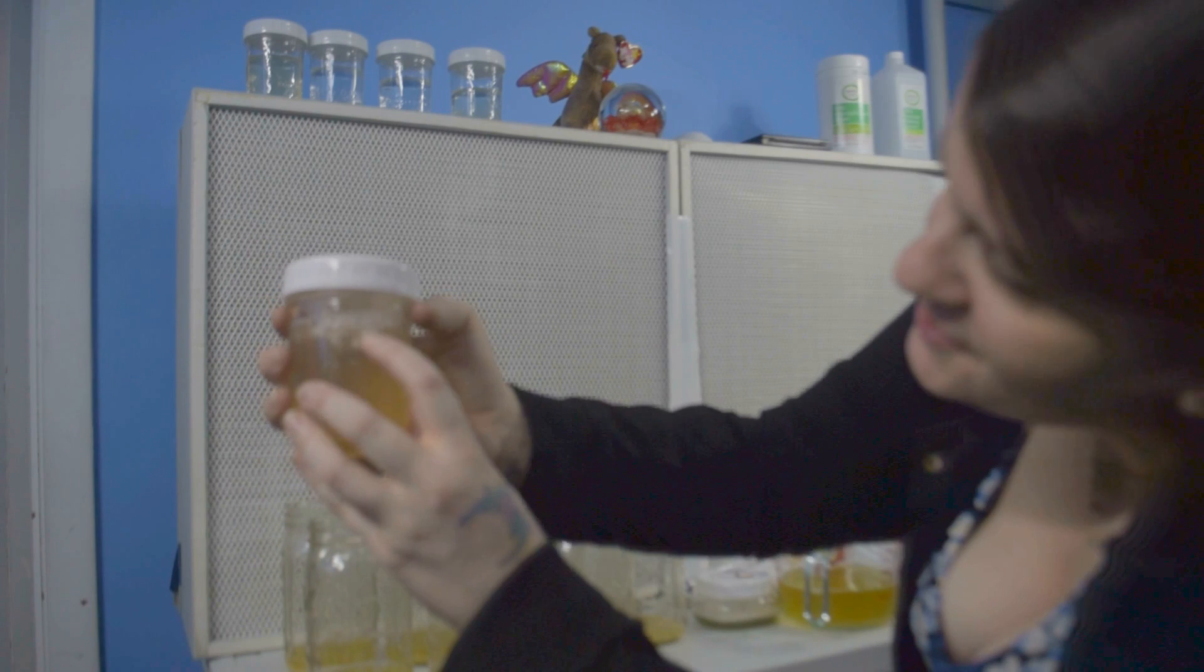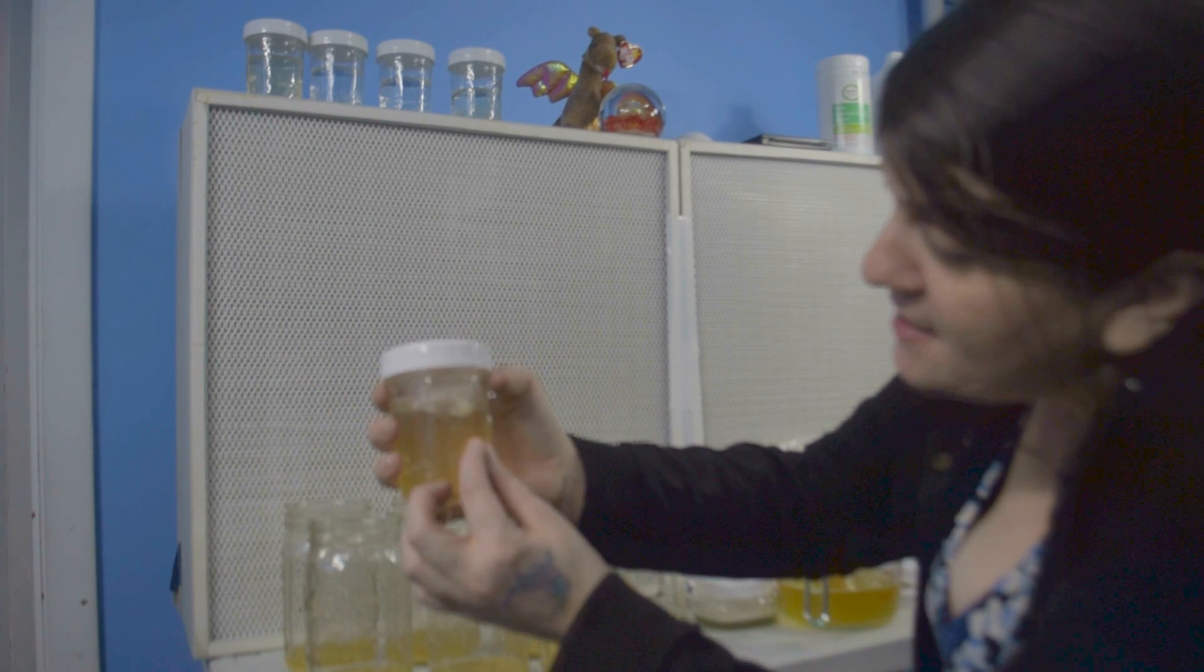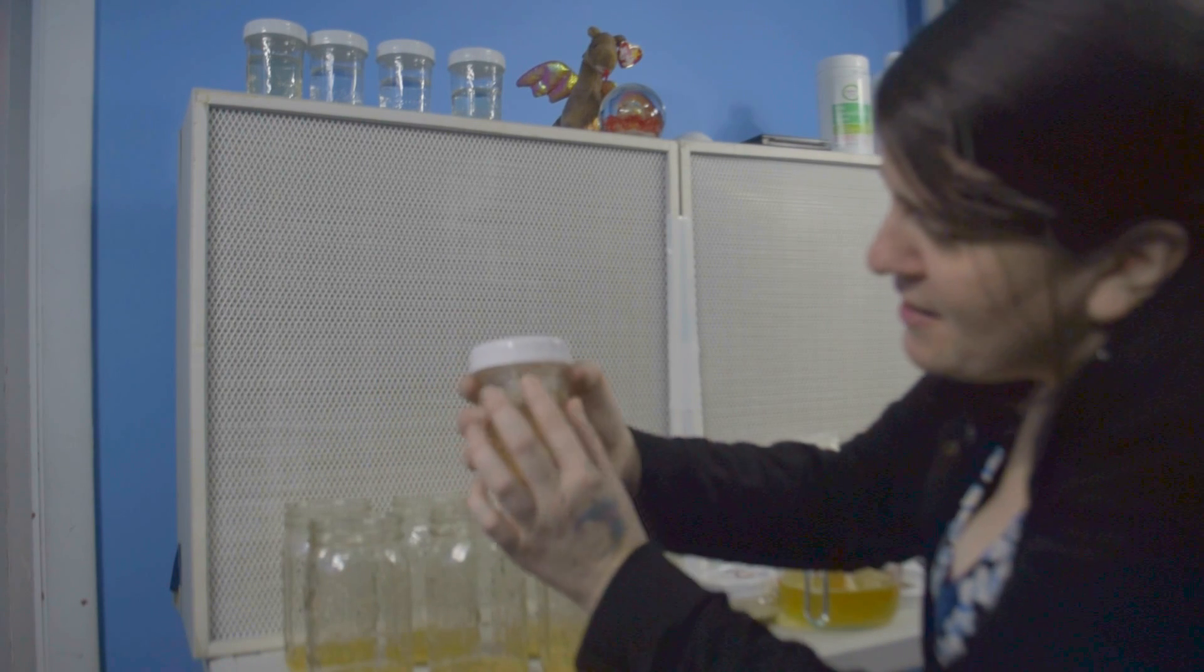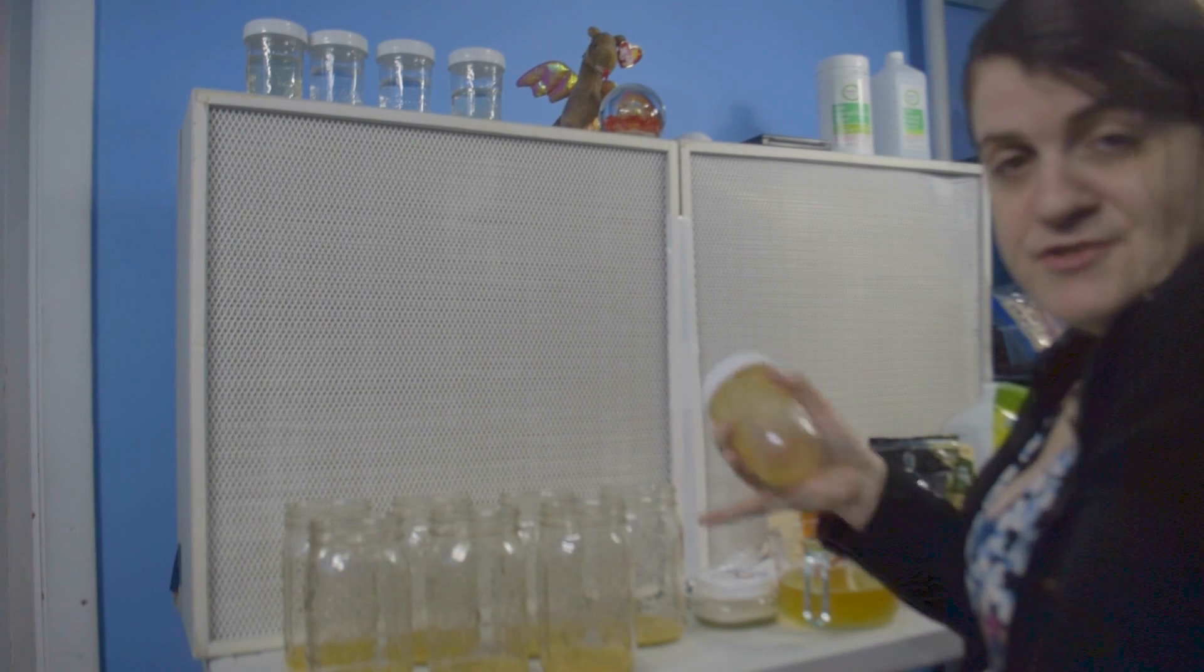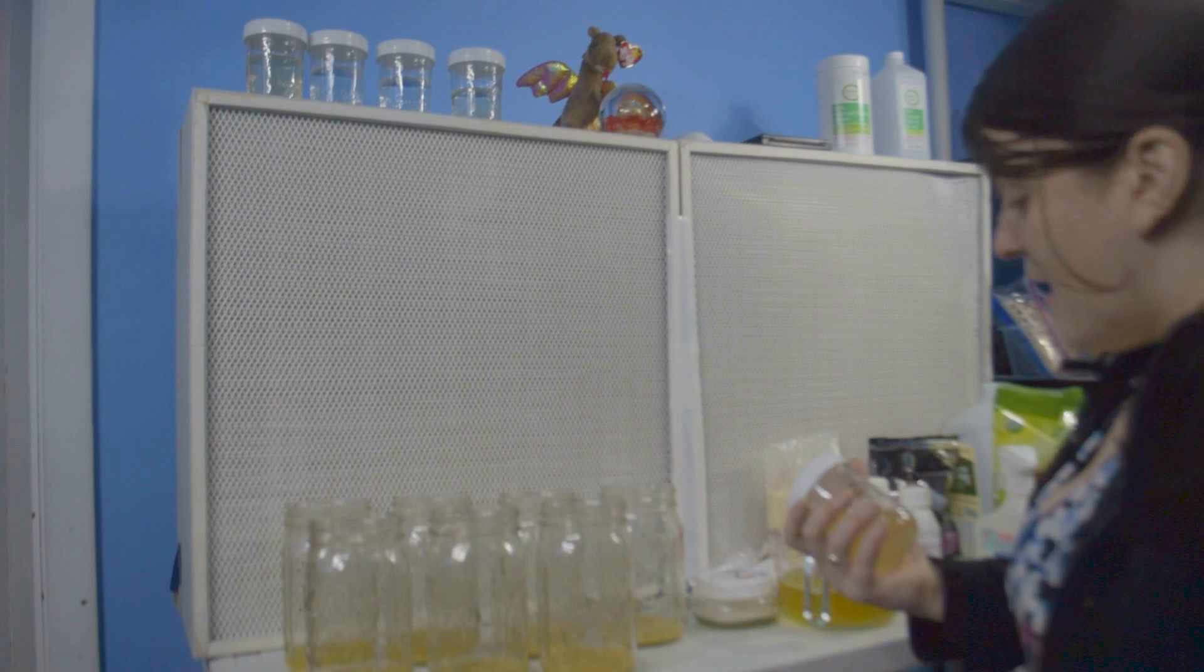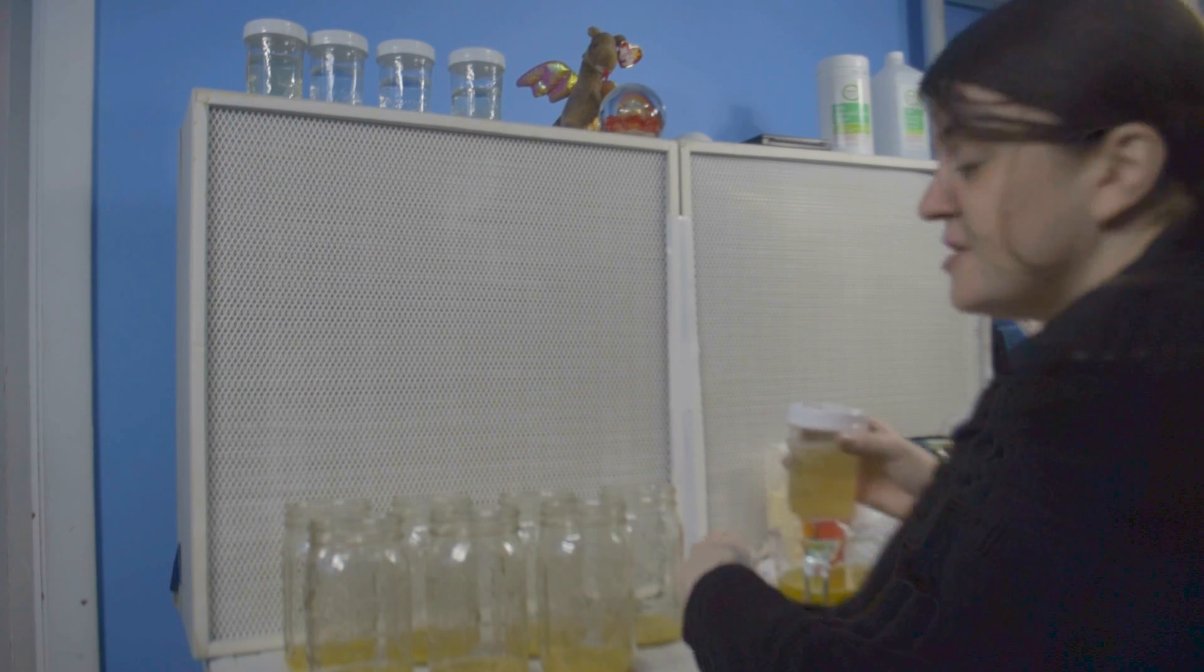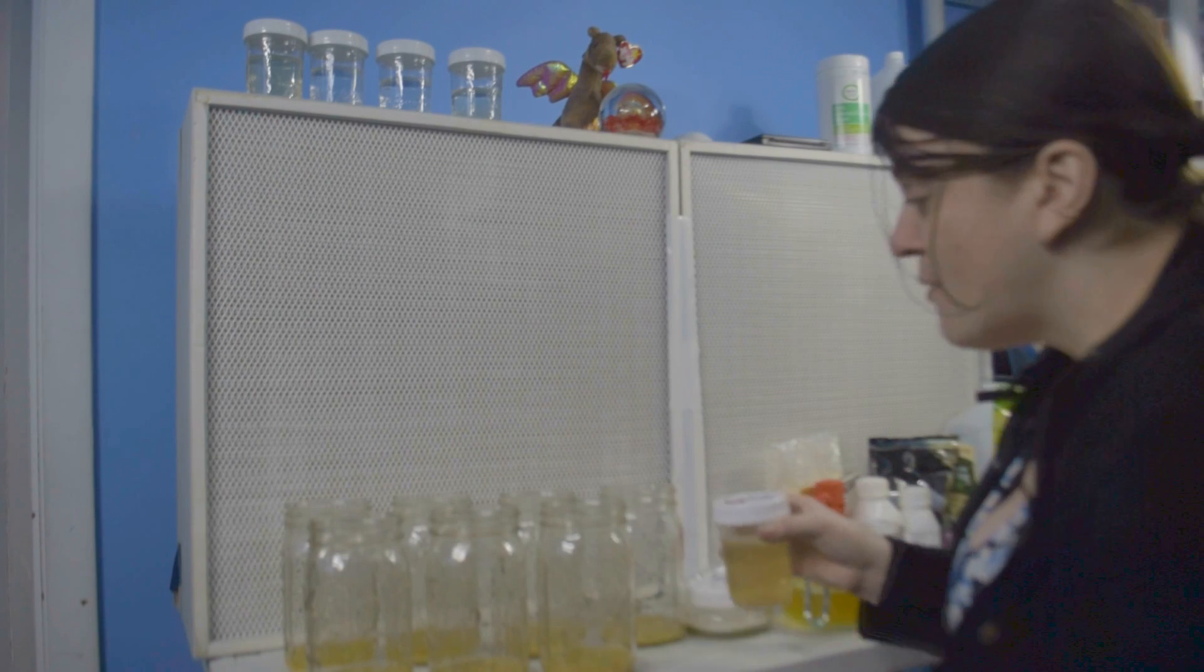You can see, I don't know if you can see it, the mycelium actually floated to the top and started growing on the surface. And if you don't shake it several times a day, you just get that. So I'm not sure if this is contaminated or not, so I'm going to try this on a couple of the jars and I'm going to try the plate in a few of the other jars. And we're going to see how that works out.